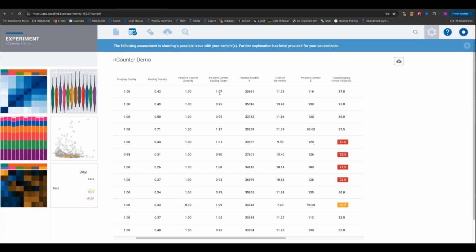Then we can look at the scaling factor. So this metric is telling us, for a particular sample, what is the average expression of the positive controls relative to the average of the whole experiment. So if the average expression of the positive controls in this sample is 1, it's basically at the average of the whole experiment. These are all really close to 1, which is what we want to see. It indicates that all of these samples are really consistent in terms of their positive control expression.